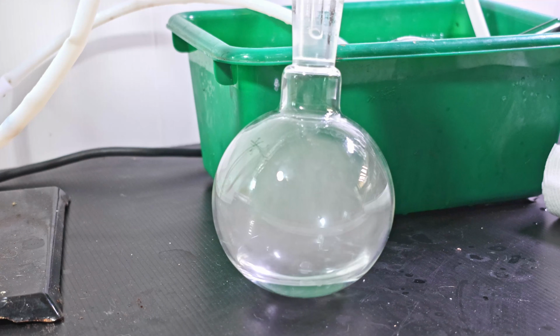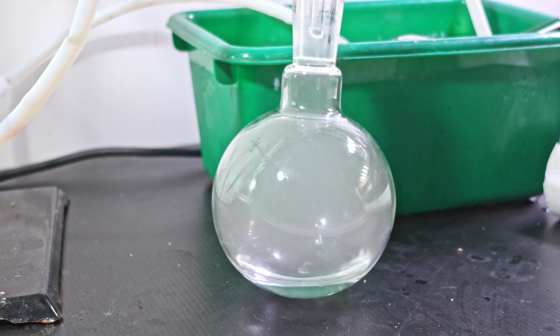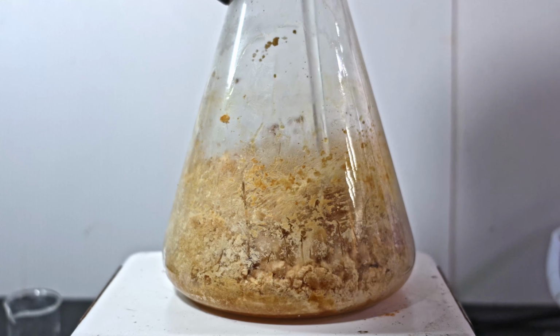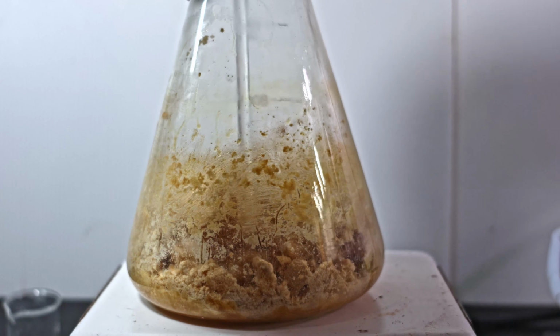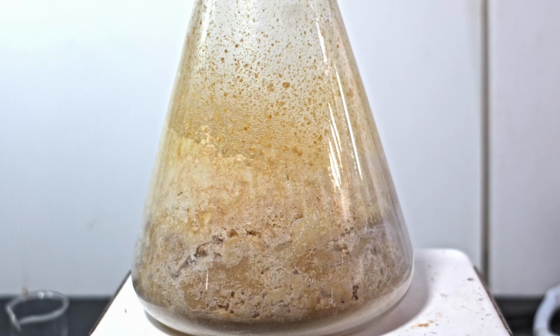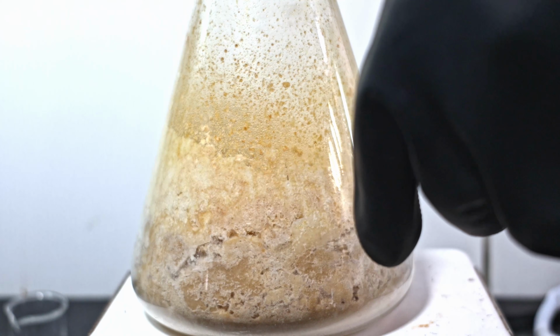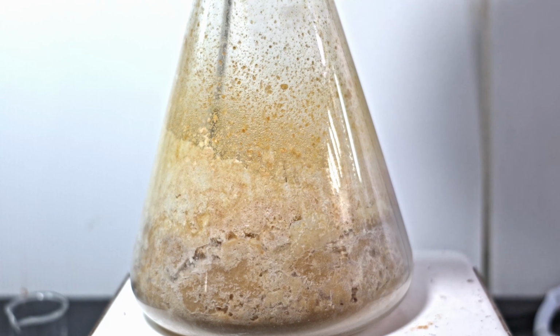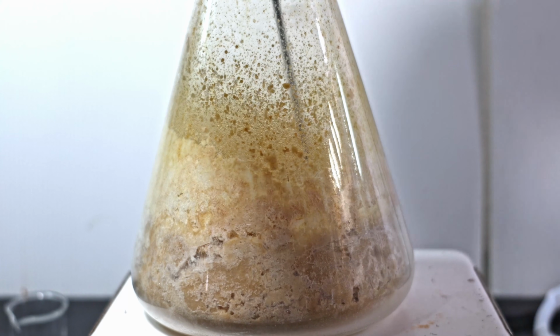In the collecting flask, an ethanol mist surrounds the distillate. Eventually, it hardens into a light yellow foam. It is difficult to pierce with a glass rod, but not impossible. Having said that, I did lose 4 rods. When cooled, I tried to break it up with a titanium rod. While it is very resistant to caustics, just losing its luster after several rounds, the mass is still too tough.